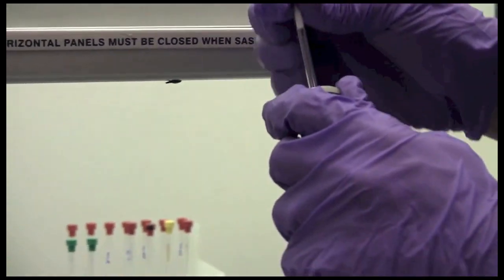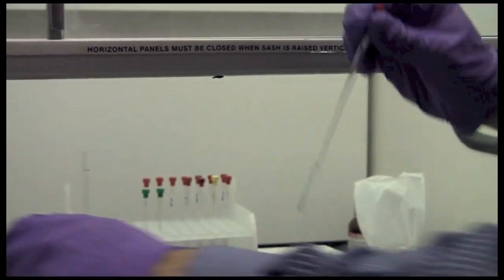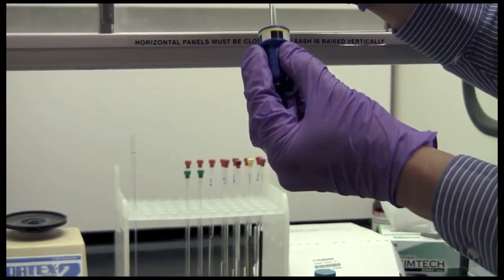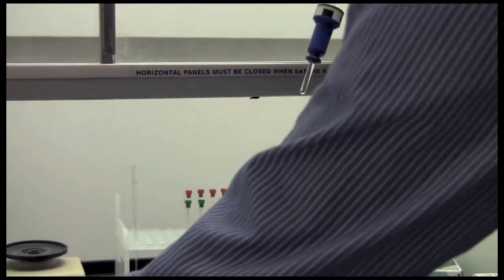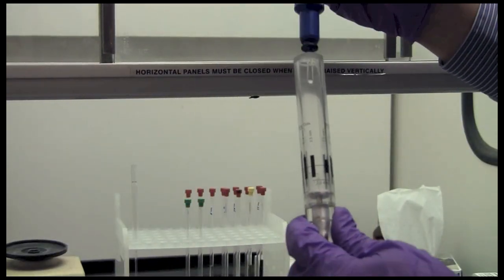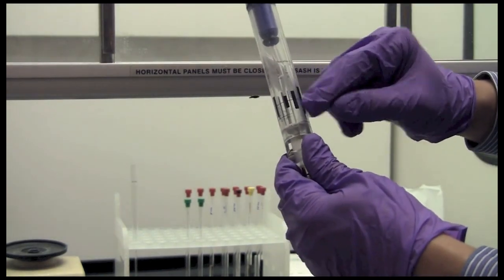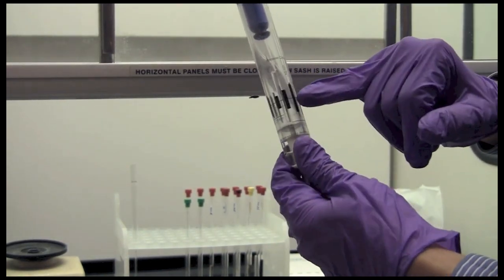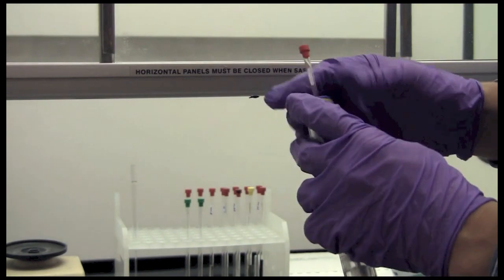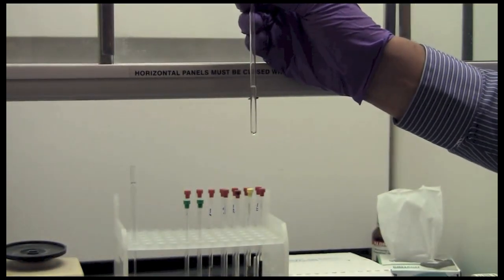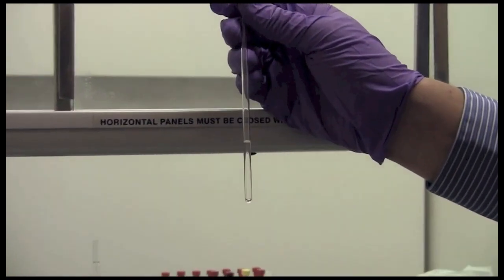Another type of spinner is the ones that are used for the Bruker samples or Bruker instruments. They go into a spinner that looks like this and they have a similar depth gauge that looks something like this and again you can just push it down either to the bottom or until you center it on the center line which is marked here.